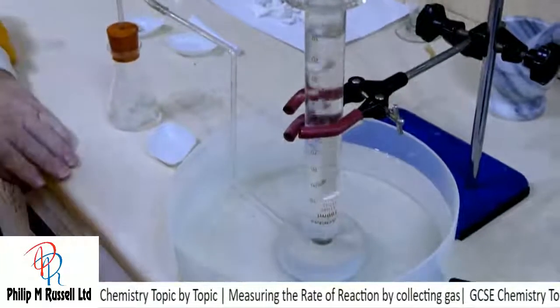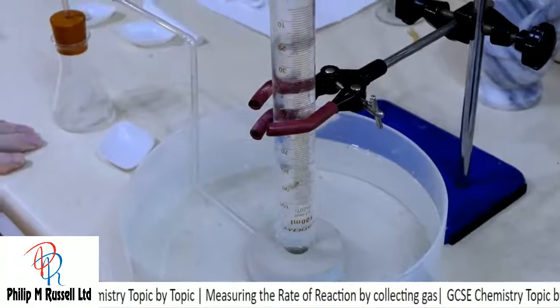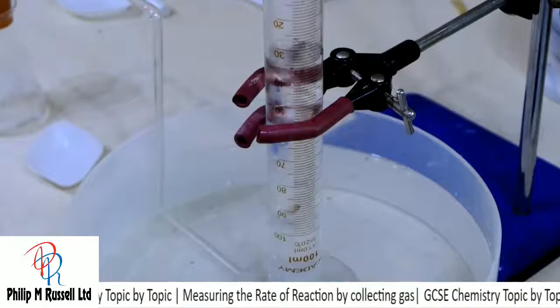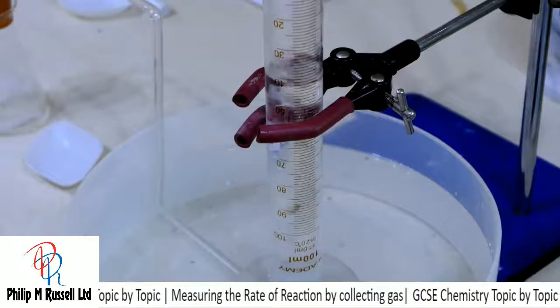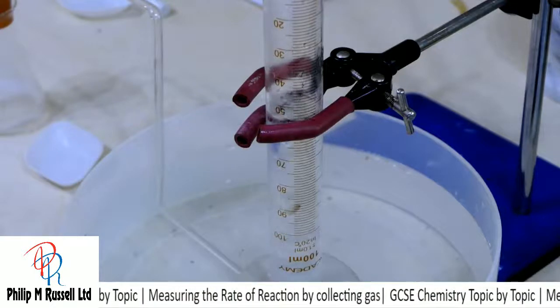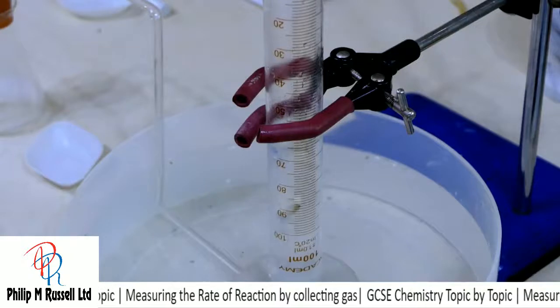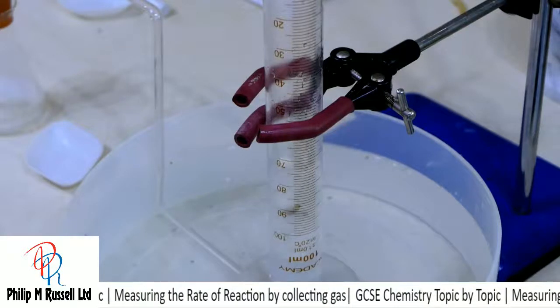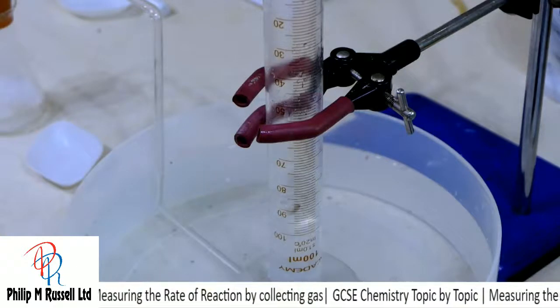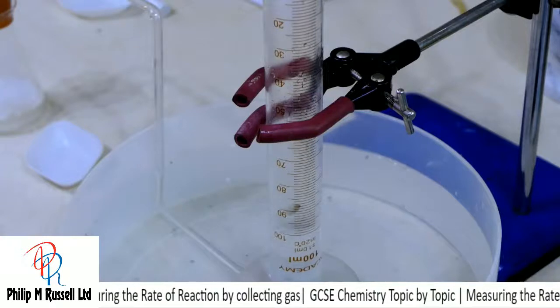And we can see as we go along, I'm going to have to start at 10 seconds. That's going to give us 21. 15, it's going to be about 36. 20, that was about 51. 25, 62. 30 was 78. 35, 92.